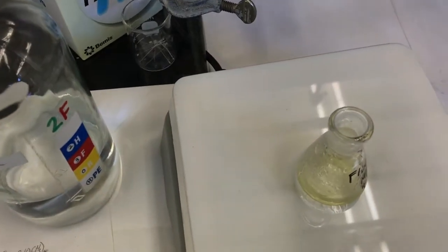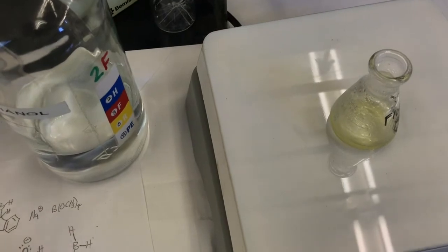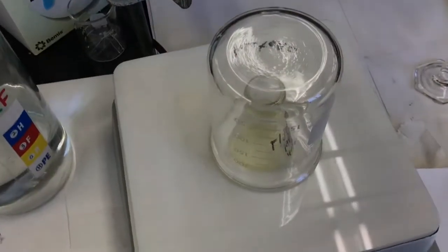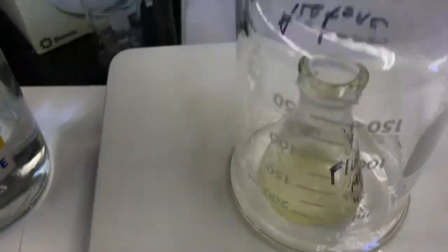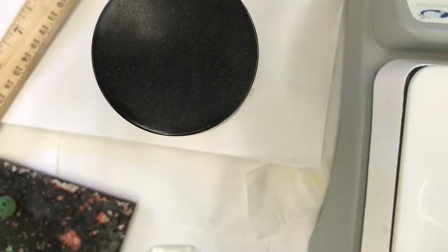What I'll do is put a beaker over the top of it. If I can get this wick out of this beaker, okay. And I'll just put this beaker over the top. The beaker is not sealed. It's got the little lip, so it's not going to cause a vacuum in there. But the beaker will fill up with the methanol water vapor and slow the evaporation and slow the cooling due to that. Okay, let's check the iodine chamber.